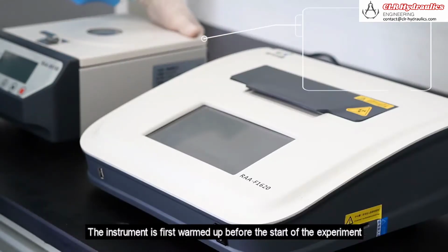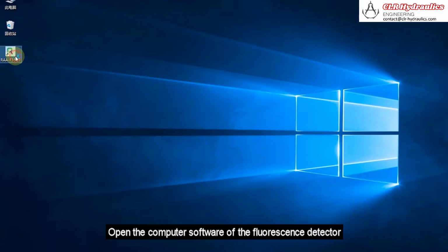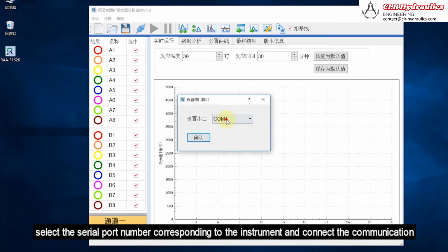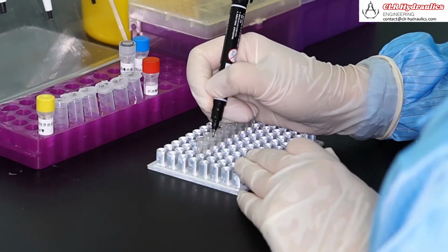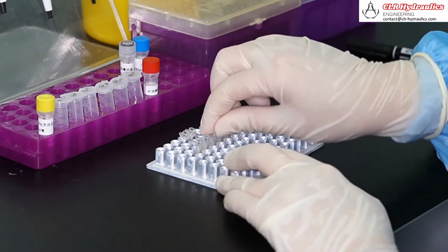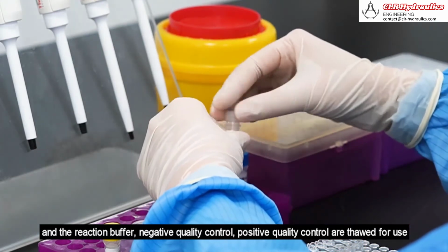The instrument is first warmed up before the start of the experiment. Open the computer software of the fluorescence detector. Select the serial port number corresponding to the instrument and connect the communication. The enzyme reaction unit is taken out and marked on the tube cover. And the reaction buffer, negative quality control, positive quality control are thawed for use.